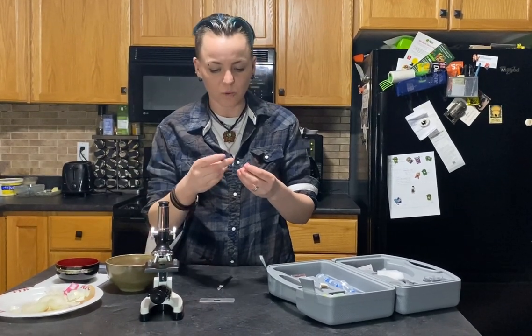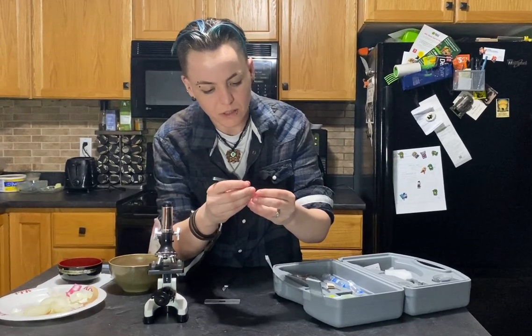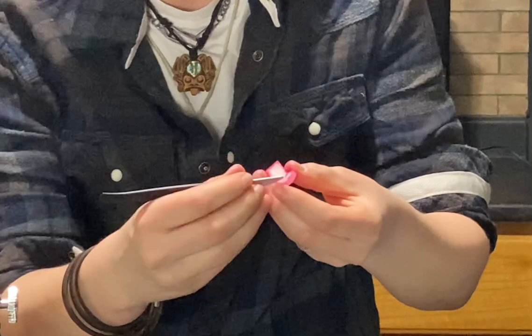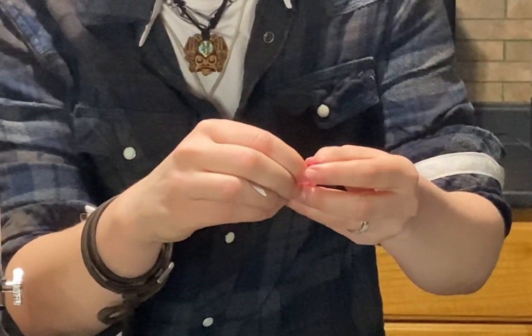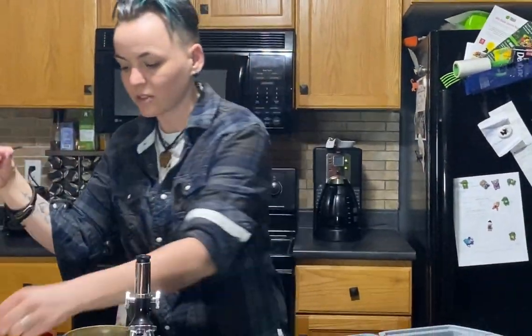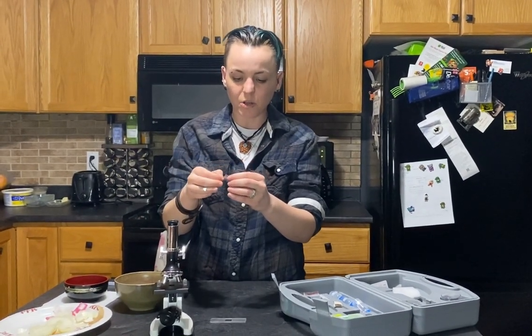You can use these tools to pick that off. If you look, you can just pick that right off — it's probably easier to use this tool actually. You can pick it off and you'll notice that this skin comes off just like that, and we have a whole onion skin. Discard it once you've used it because you can't use it again, and there you go — you have an onion skin.